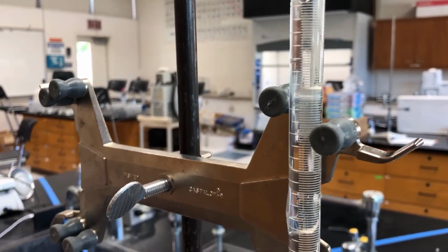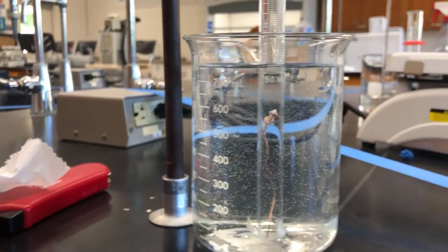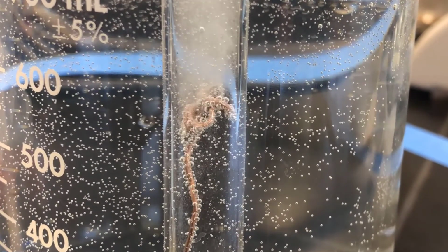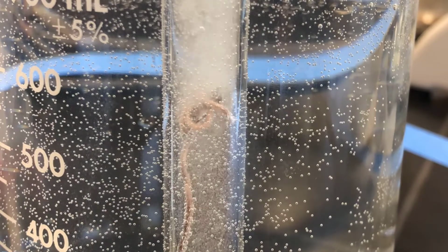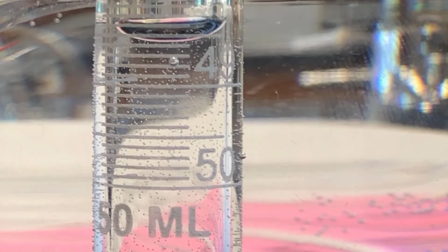You can actually see the hydrochloric acid sort of slowly moving down. This happens in this experiment sometimes, and you can see there's a pretty good sized chunk of magnesium up here. If you wiggle it, you can get it to react faster. So I'm going to spend a little time doing that, and hopefully it will all react away. See that? Okay. So there you have it. That's again the 49 mark.